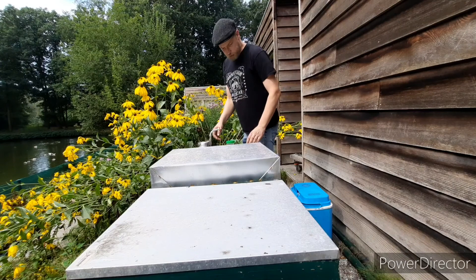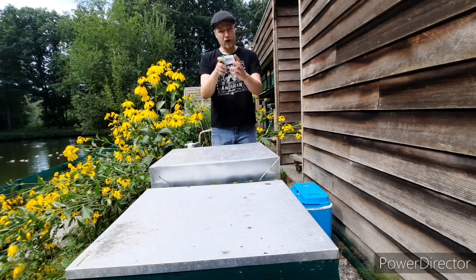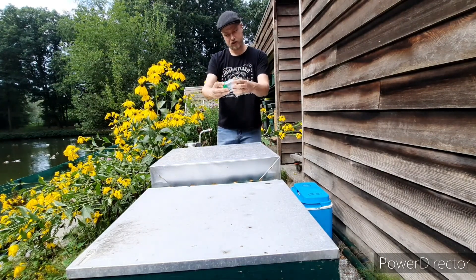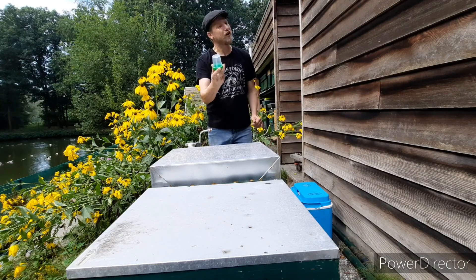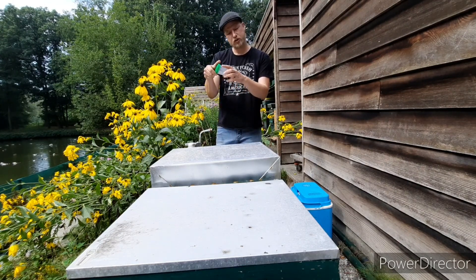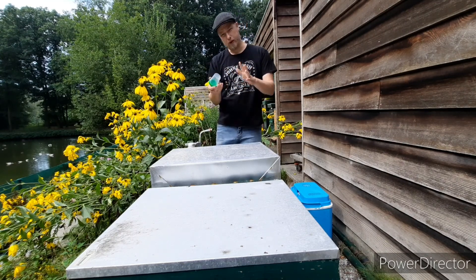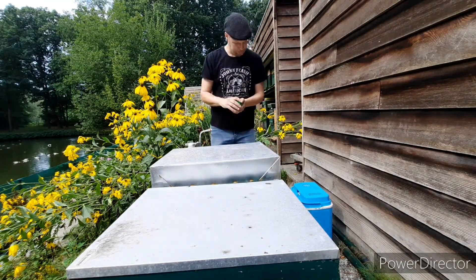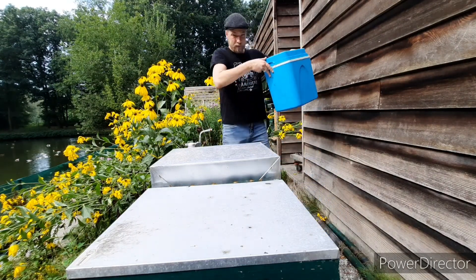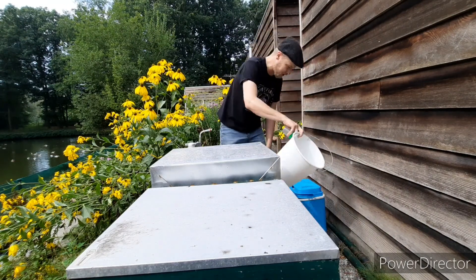So what do we need for that? Our smoker, our hive tool, a little bee cup from the hospital where they test your bees in — a clean one of course. This holds approximately 30 grams, a bit more or a bit less, of bees. And our cool box, and the bucket to shake some bees into.